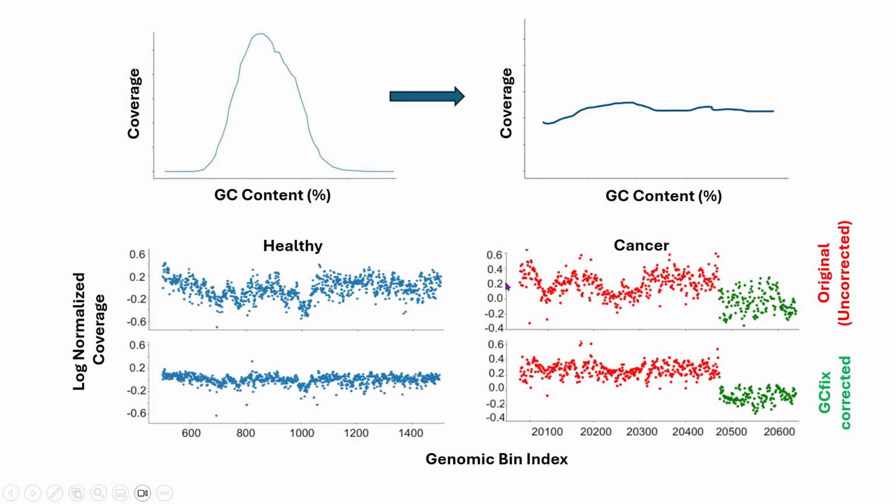It is well documented. Okay, so this is the cancer sample. In a cancer sample, you can have regions where you have amplification and regions that are neutral, so no amplification basically. You can also have deletion, but we are not showing that here. We are only showing amplified regions and neutral regions. Now you can see that before GC correction, the regions are actually mixed. They have abrupt changes and are very noisy. But after GC correction, you can see that they clearly separate out and are very uniform within the areas where the amplification is happening and where the neutral region is taking place. So that is the impact of GC correction.